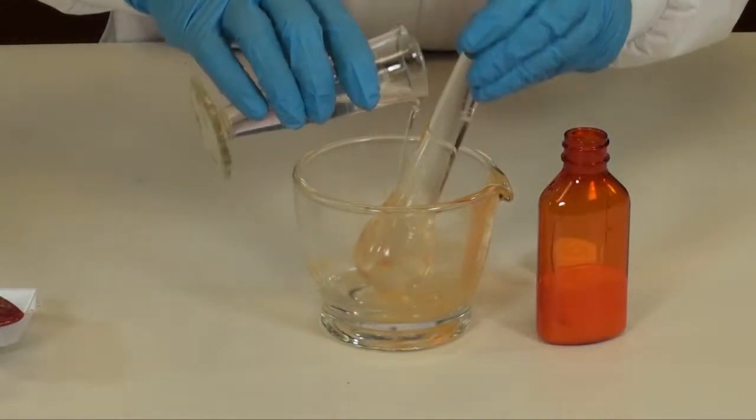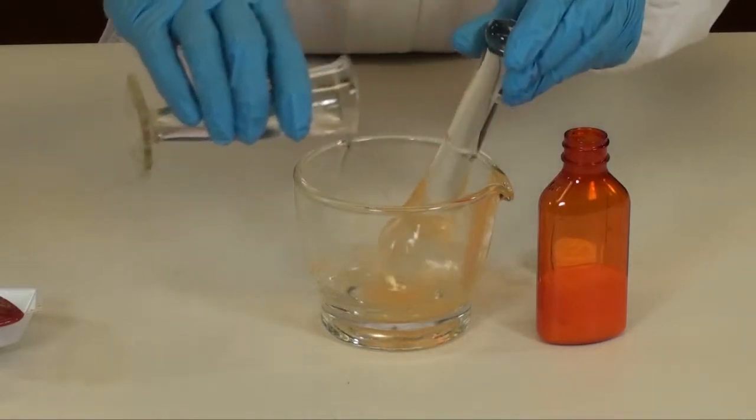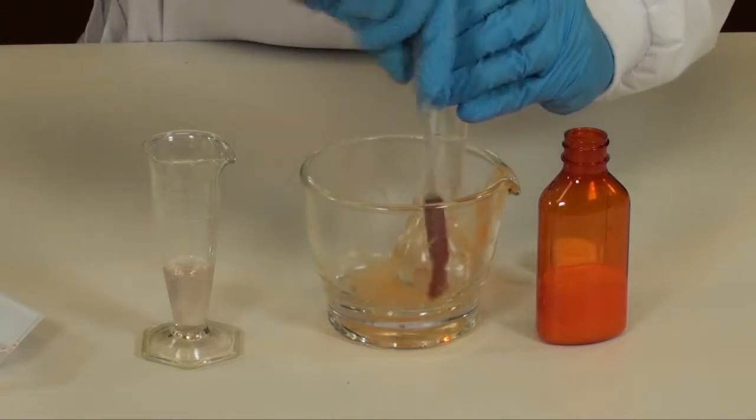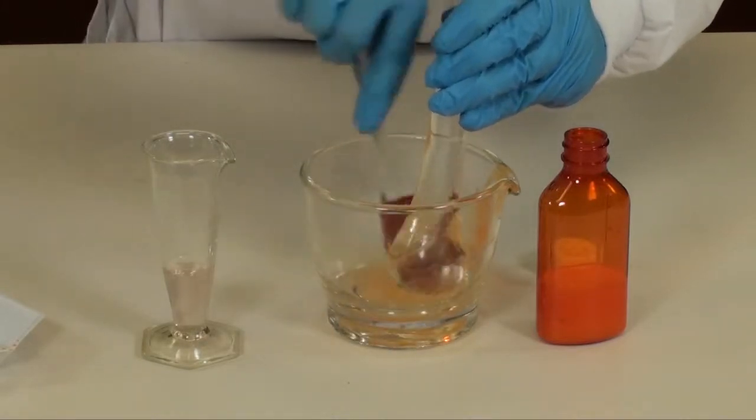You will need to rinse two or three times in order to remove the drug and dispense the entire amount for the patient.